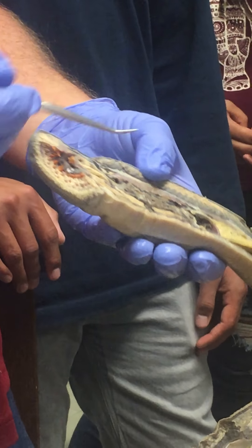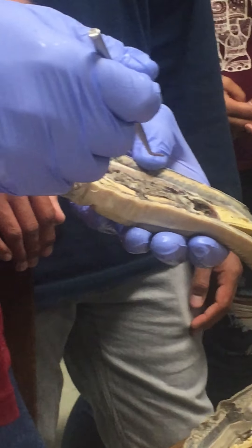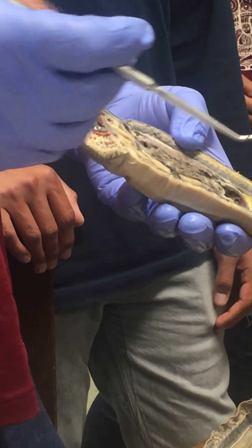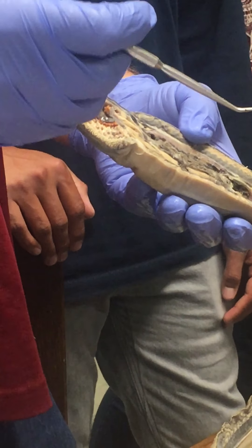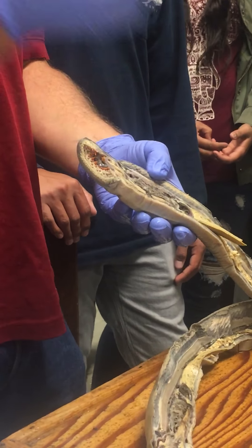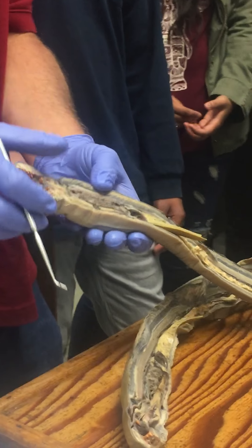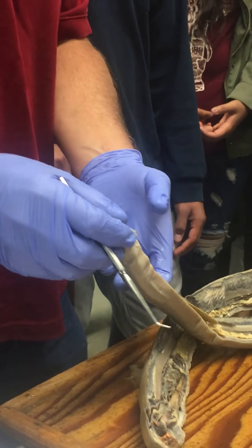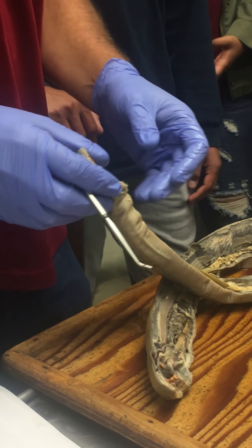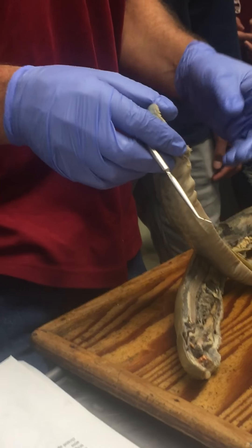What the hypophysial pouch does is allow the pressure changes happening in the branchial region — as they breathe and pump water in and out of the gills — to also move water in and out of the nose so that the lamprey can smell. And you can imagine that if you're trying to find fish to hook onto, being able to smell well is important.